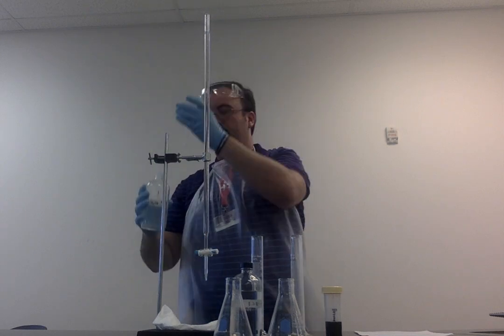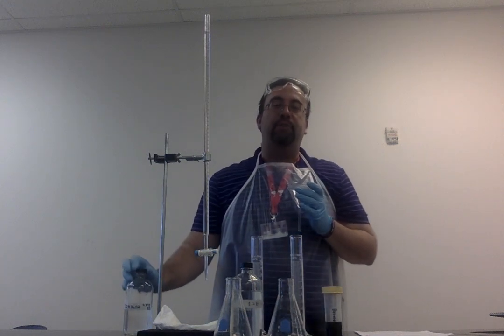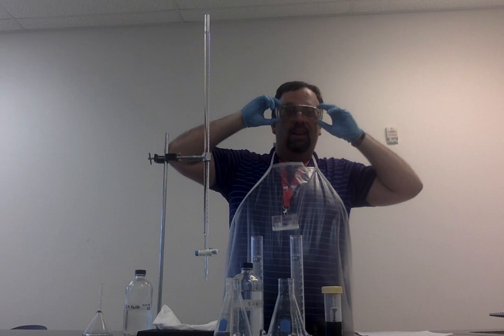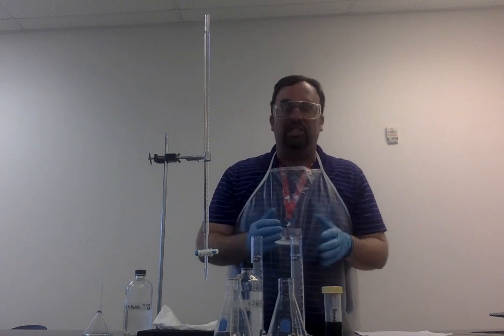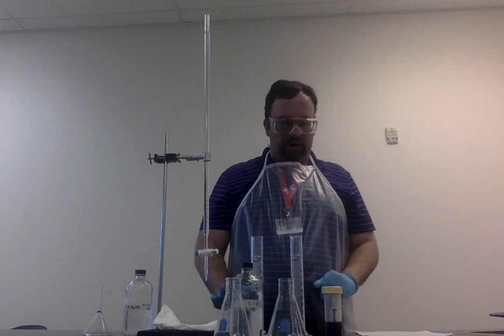All right. Great. Notice that because I'm dealing with a strong acid and a strong base, I do have to make sure that I'm wearing my protective gear. I also need to remind you, I just forgot, you need to wear goggles as well. You don't want any acid or bases splashing up into your face. And so now we're ready to go ahead and get started.